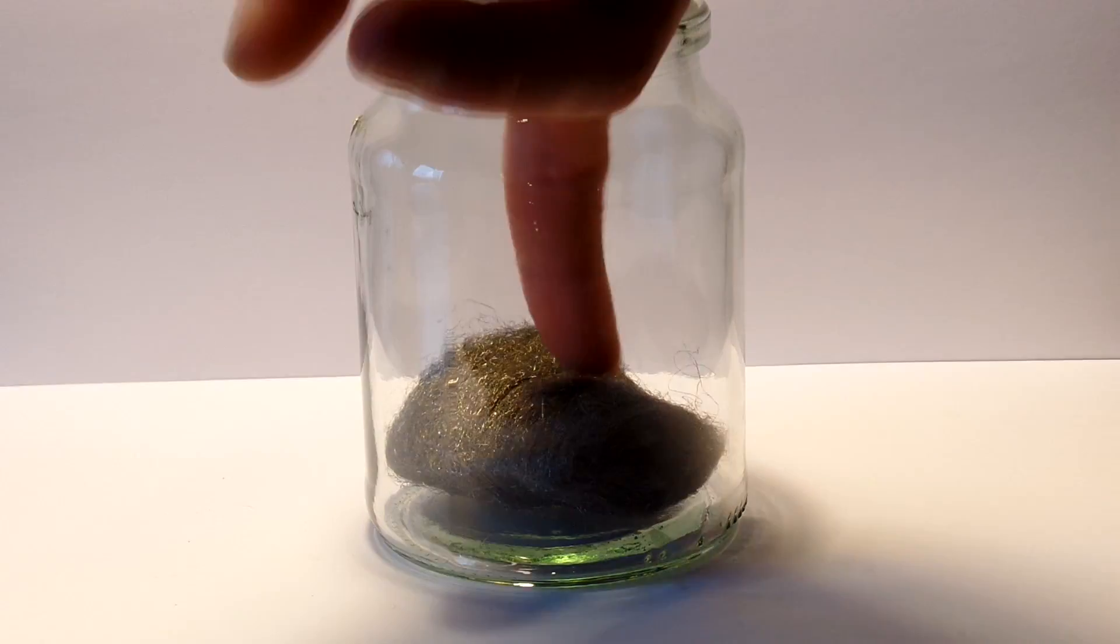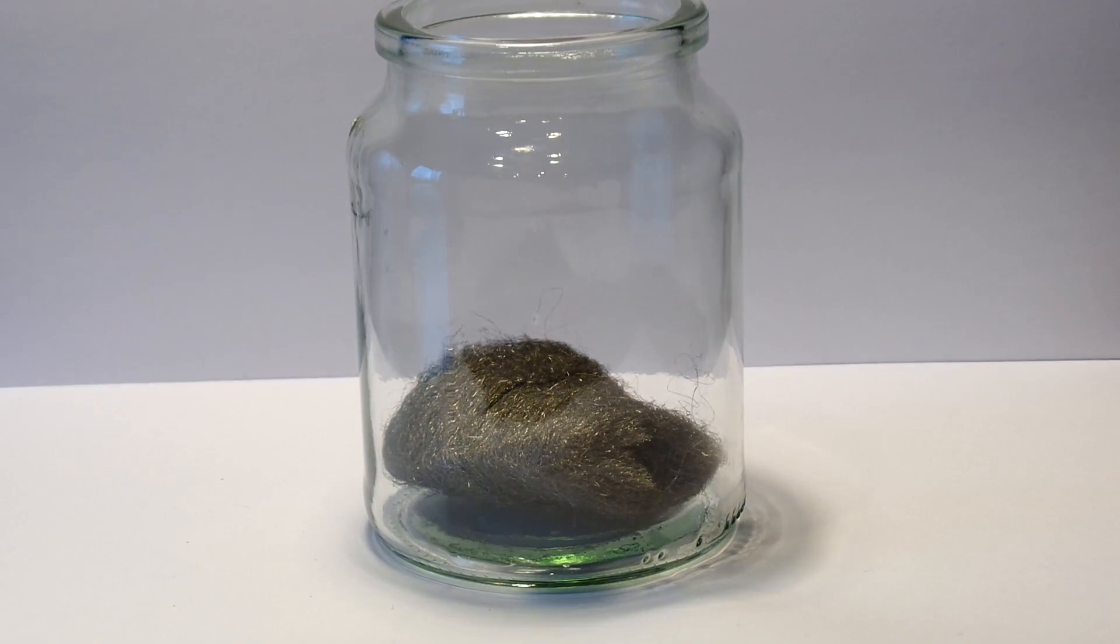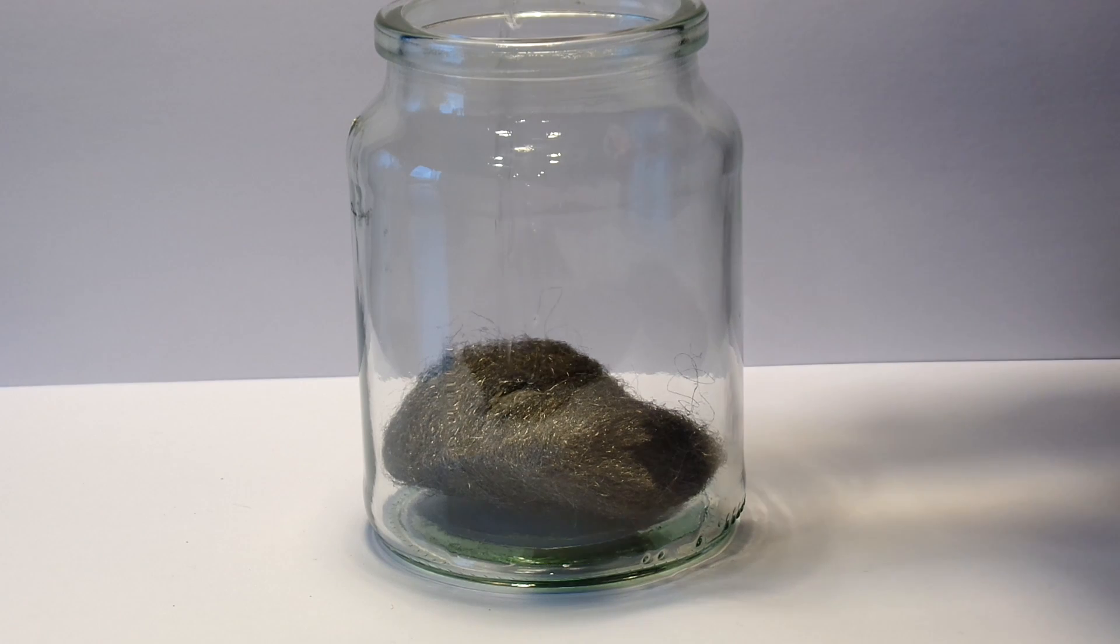Here is about five grams of steel wool washed free from soap and dried. About 30 grams of 28% hydrochloric acid is added.